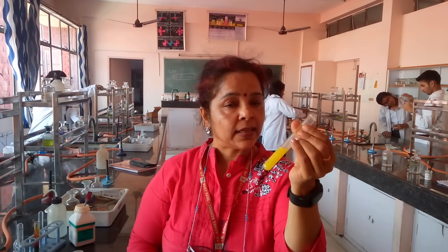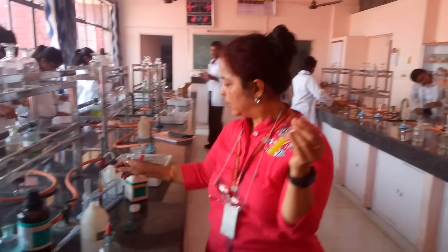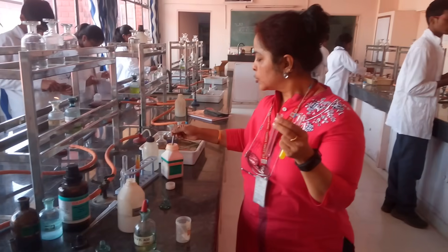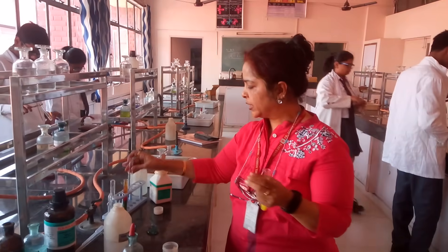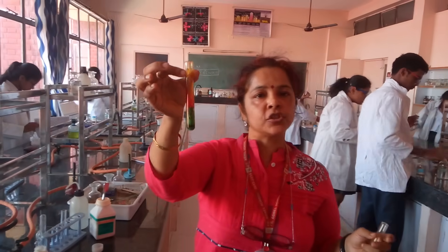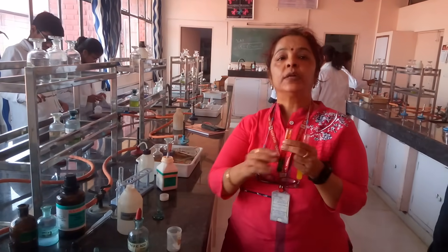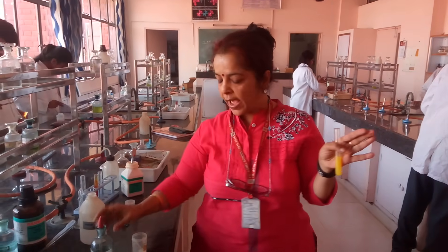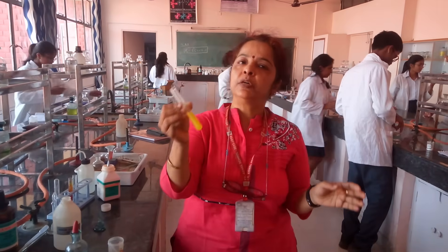This is exactly how you do the chromyl chloride test. A quick recap: into a fresh dry test tube, add your salt, then add solid potassium dichromate, followed by concentrated sulfuric acid — this generates a reddish brown gas. Pass it through a transparent sodium hydroxide solution, which will turn yellow in color with no precipitate. After this, add lead acetate, which leads to the formation of a yellow precipitate of lead chromate, confirming the presence of chloride.